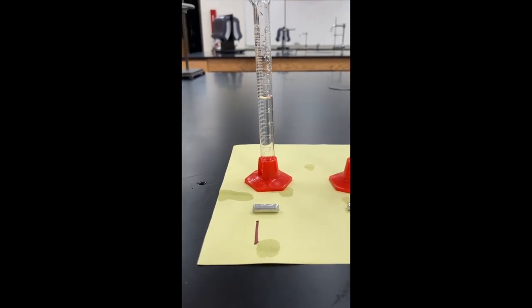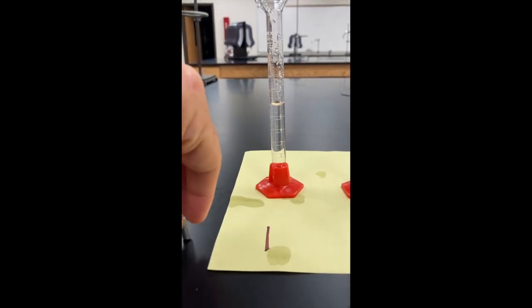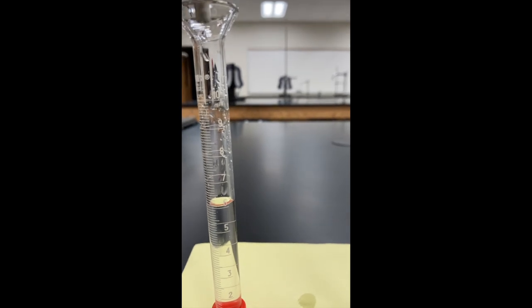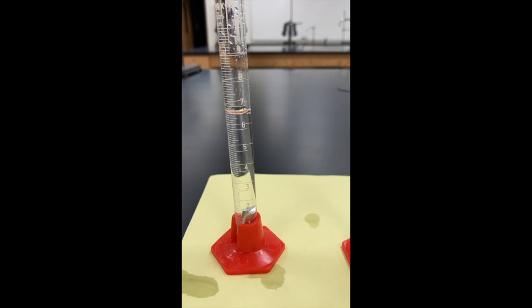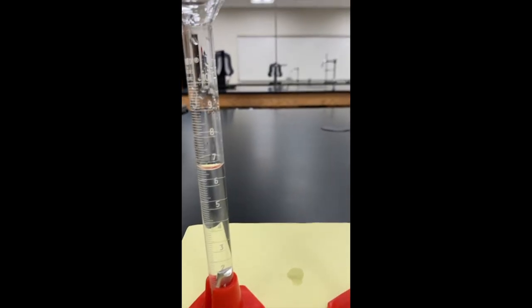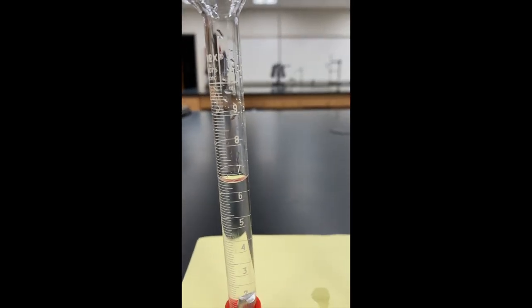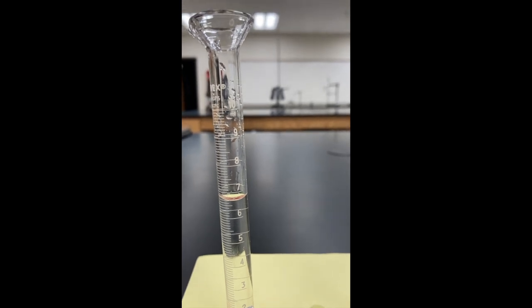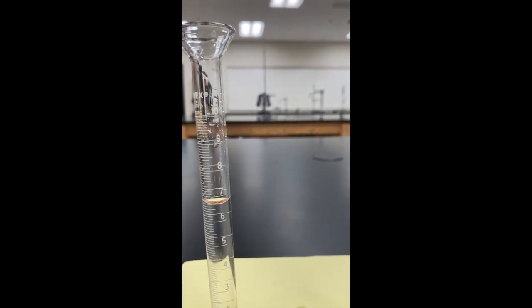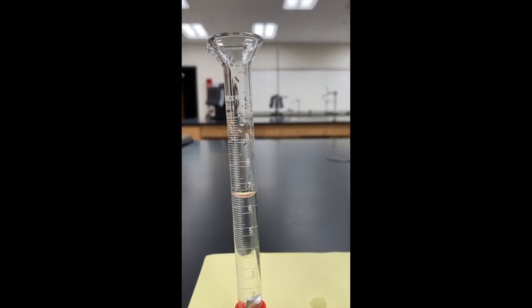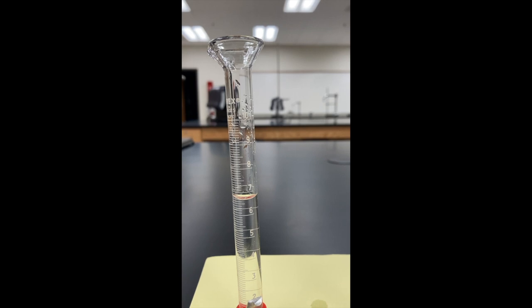Okay, I'm going to take piece number one and I'm going to put it in the water, and we'll watch what happens. So piece number one is in, the material is in the water right now, and now the volume of the water appears to be about 6.7.